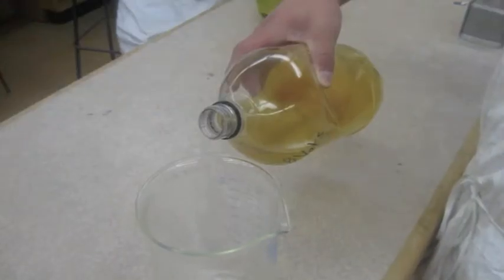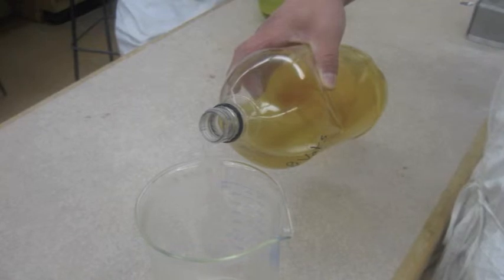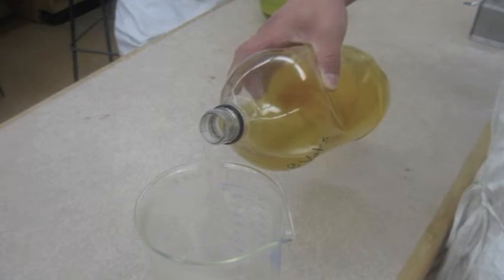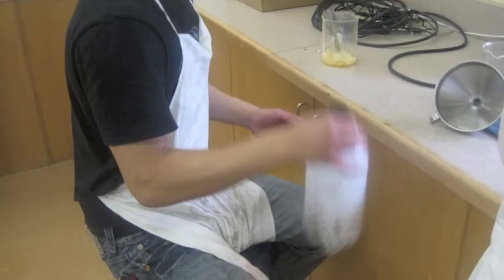At this point, your biofuel should have a layer of glycerin at the bottom of the plastic bottle, which can be easily removed since it is waste. Using a clean 1-liter beaker, remove the clear biofuel from the plastic bottle into the beaker and dump out the waste glycerin in the sink. Then wash the bottle.